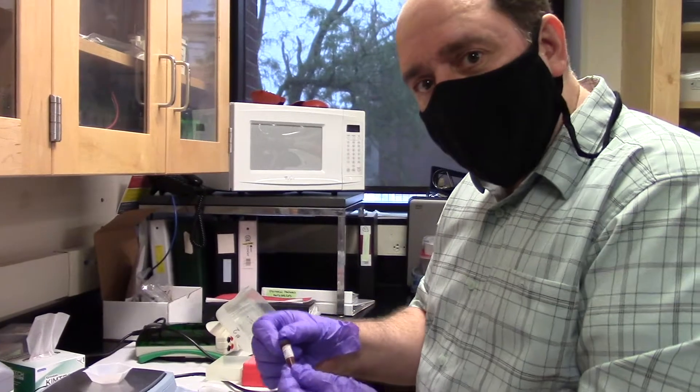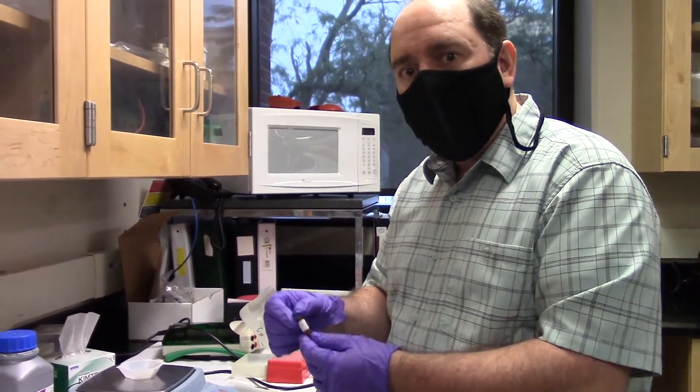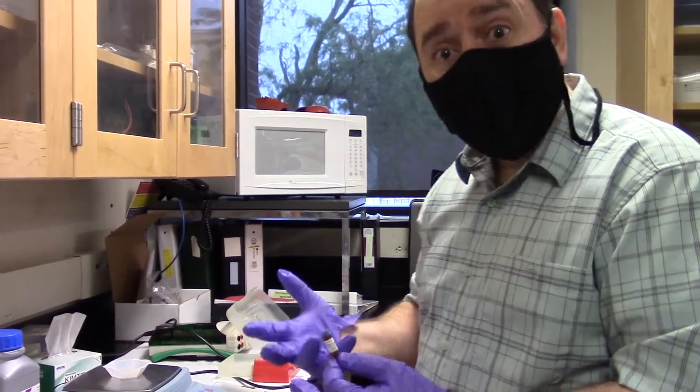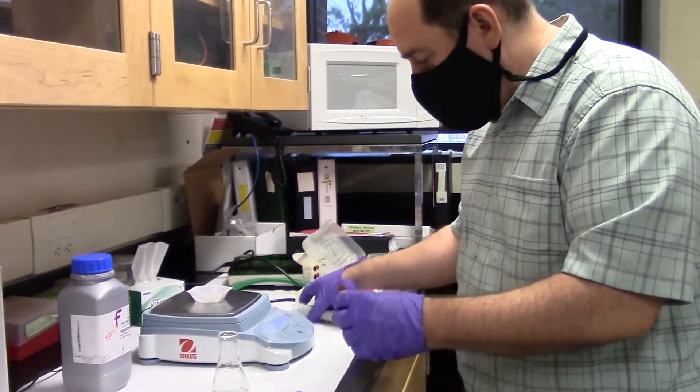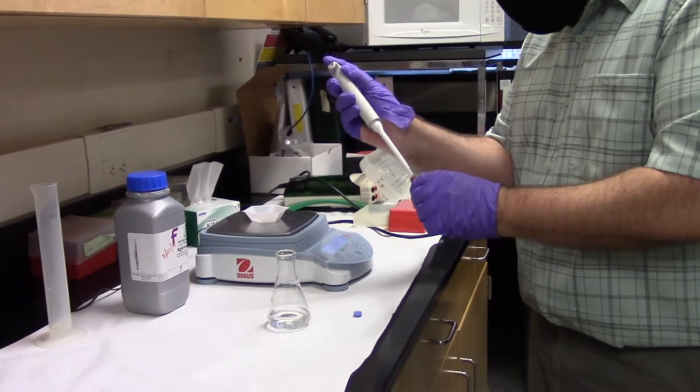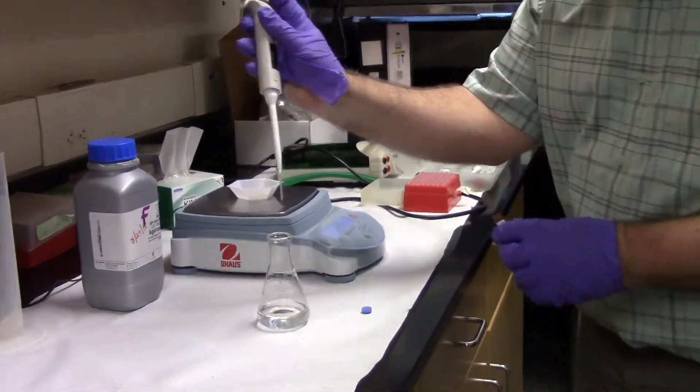This allows us to see the DNA under a UV light. And therefore, we'll be able to take pictures of it as this molecule, this red fluorescent molecule fluoresces. See the red?